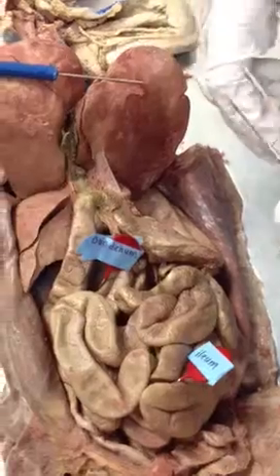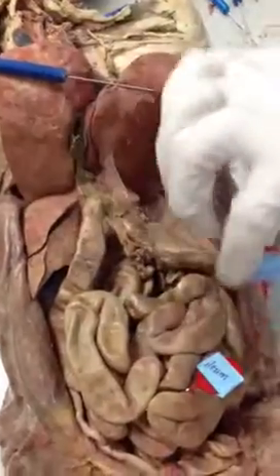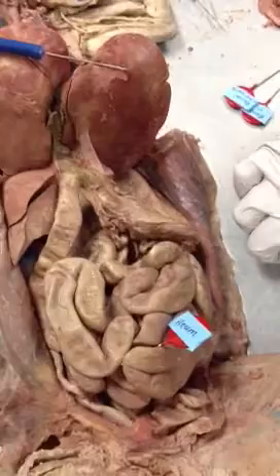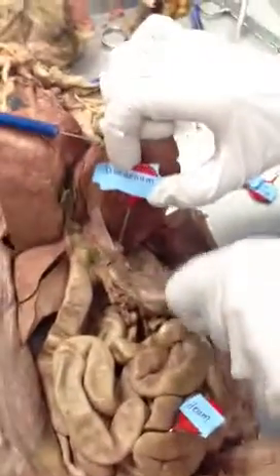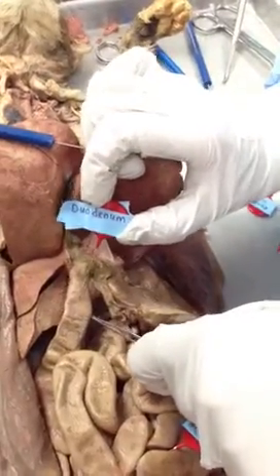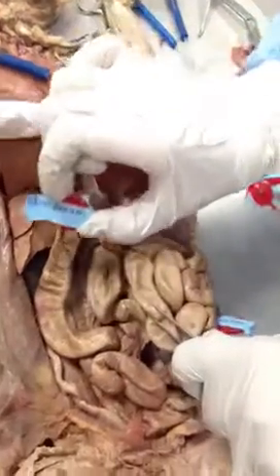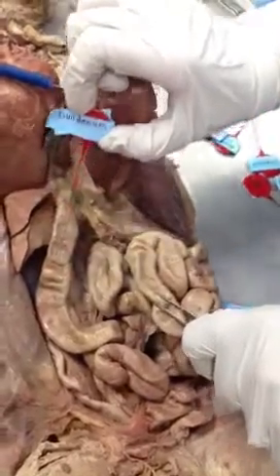The entire small intestines, I'm going to take this out for a second. The small intestines cover right here from the duodenum all the way through this, and we're going to go through the categories. The first portion of the small intestine is the duodenum. So we have our pylorus, which is part of our stomach, and then we enter the duodenum, however you want to pronounce it. It starts here, and it curves around and makes a U. So this is where we see the duodenum.